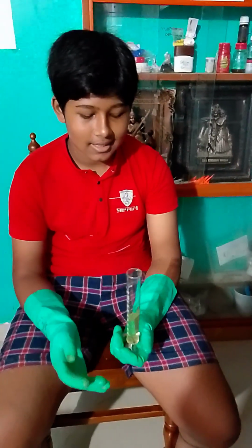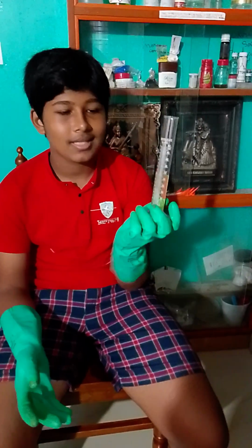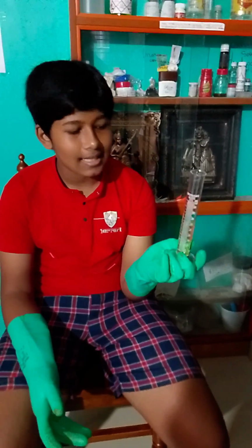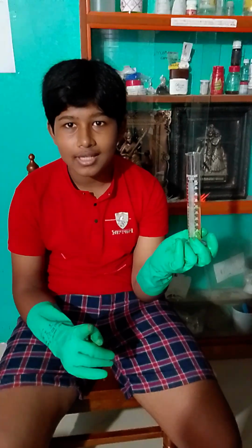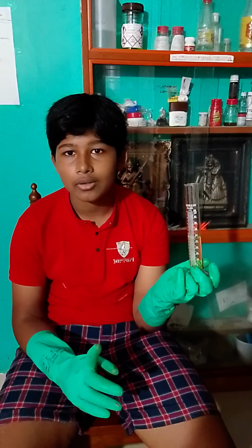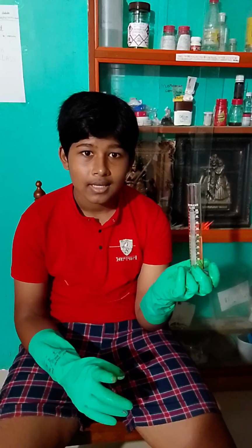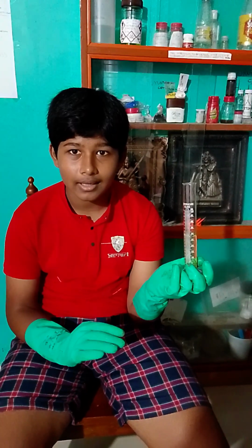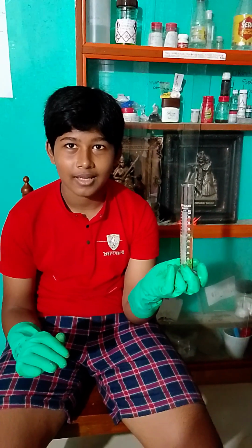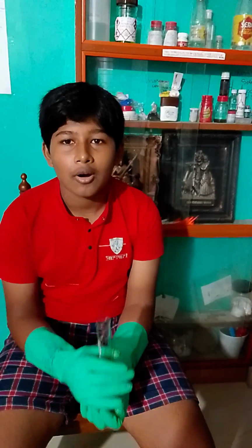Okay, I know handling sulfuric acid like this, keeping it on your hand, is not good, but I must say that this is sulfuric acid, a little colored, no problem, but we can boil it to concentrate. Do not try this at home at all, even if you want sulfuric acid very badly, because it is corrosive. It can destroy you. I mean, destroy, which means delete you from the face of the earth. So do not try to use this thing or make this thing.